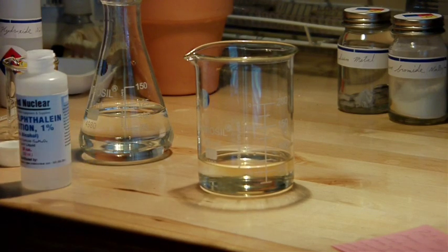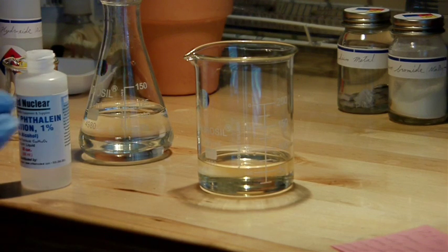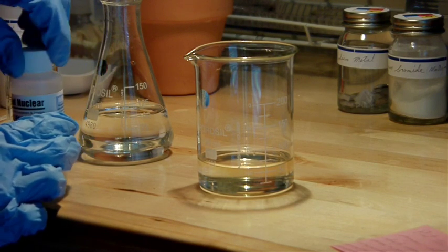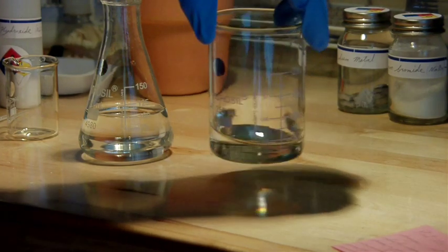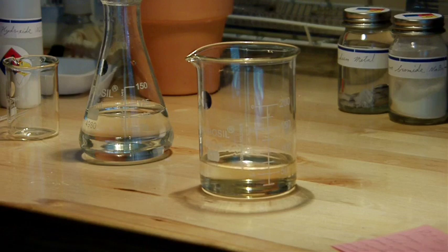So this will turn pink once the pH of this solution reaches the equivalence point. So you'll know immediately when you've completely neutralized the acid.